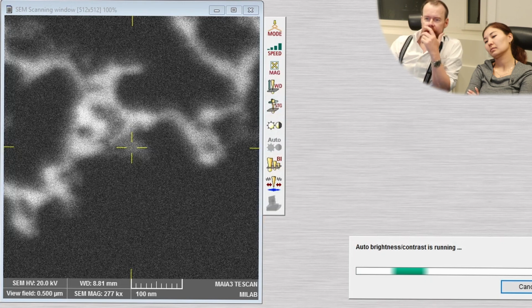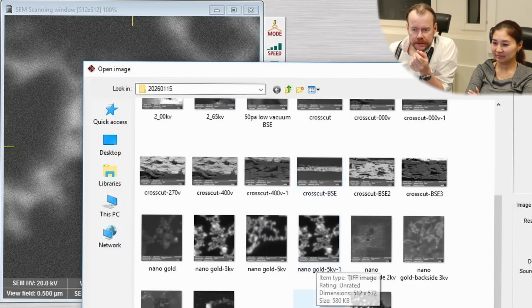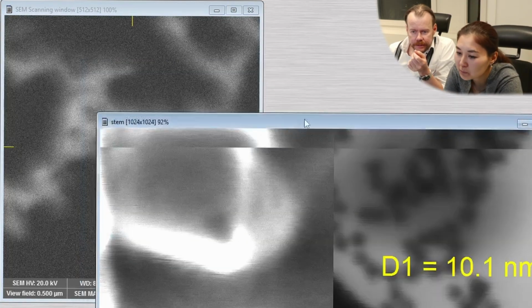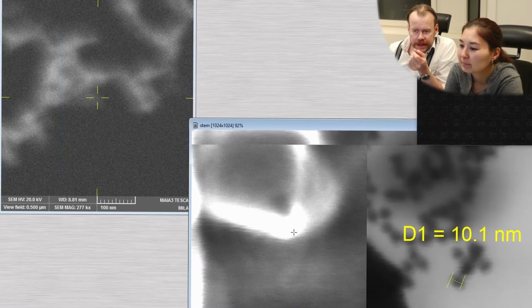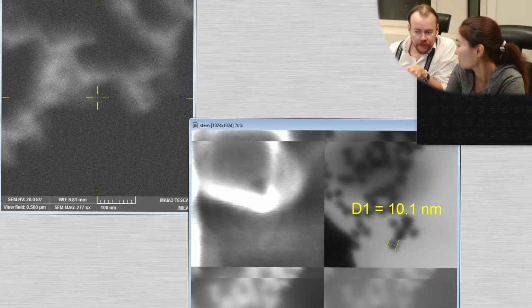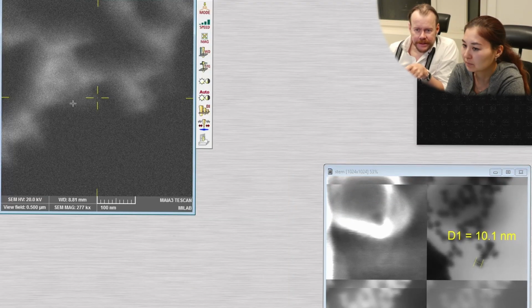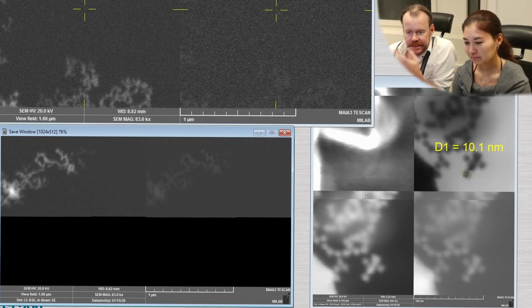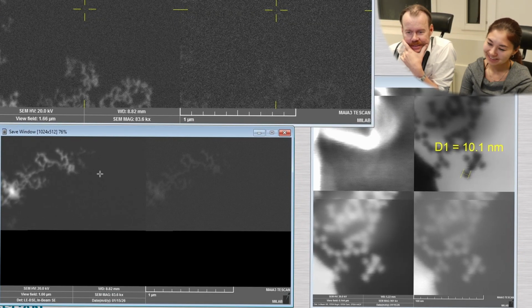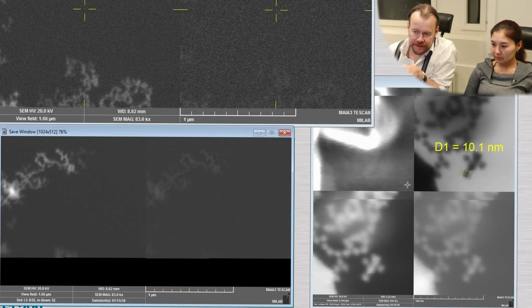This is as good as we get. I mean, you remember that in the STEM image, do I have it left here? This was the SE signal, the top left image there. So it looks so much better in the STEM. The resolution is so much better. And now this is the backscattering signal, so this is not the SE signal. There is a difference in resolution at least. Those particles, this is about 10 times lower magnification compared to the STEM image that I have here.